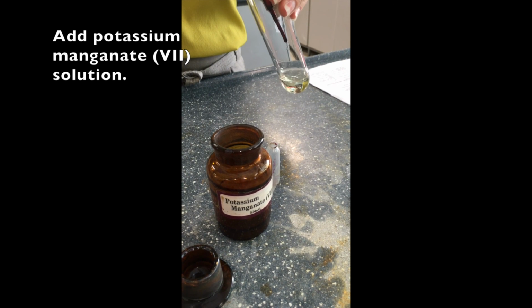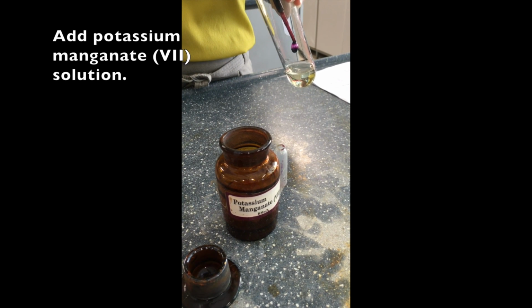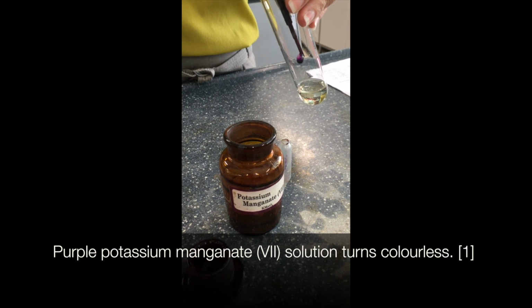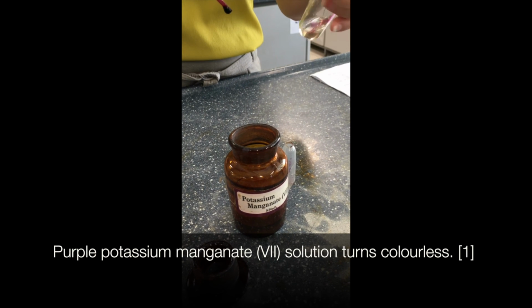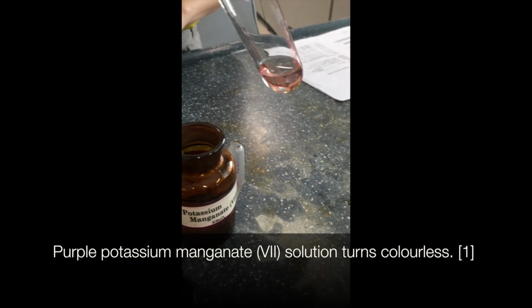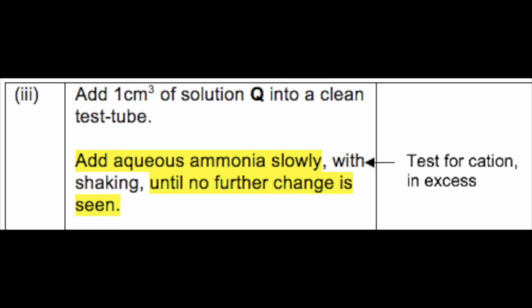So the instruction says to drop potassium manganate until you get a pale pink. So we add drop by drop and we make sure that every drop of the potassium manganate has gone into the solution. So here you can see that there is some potassium manganate at the sides of the test tube. So we ensure we shake everything in and we can see that it turns pale pink. So you need to do this portion slowly. Okay, now that pale pink solution is solution Q.